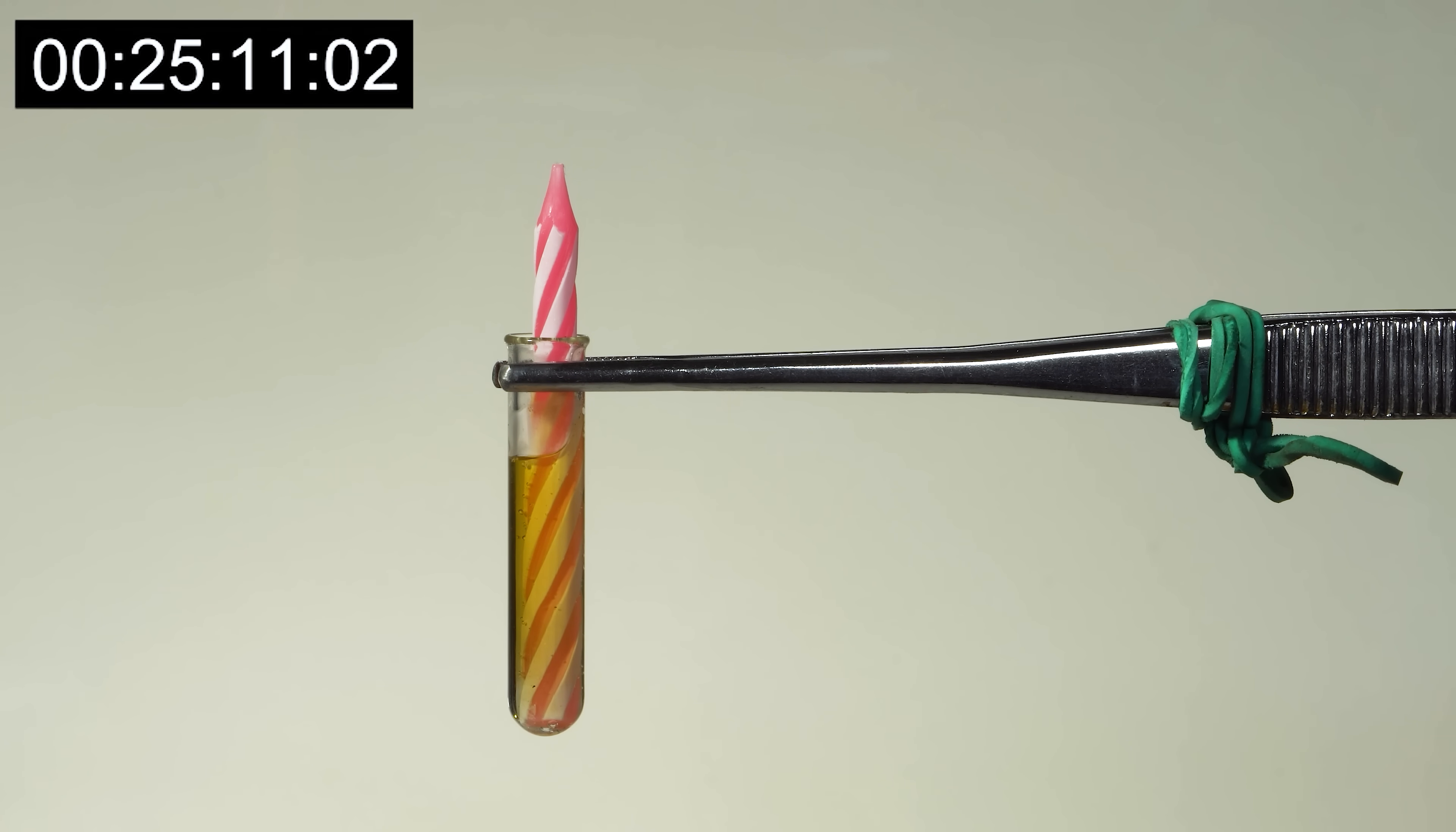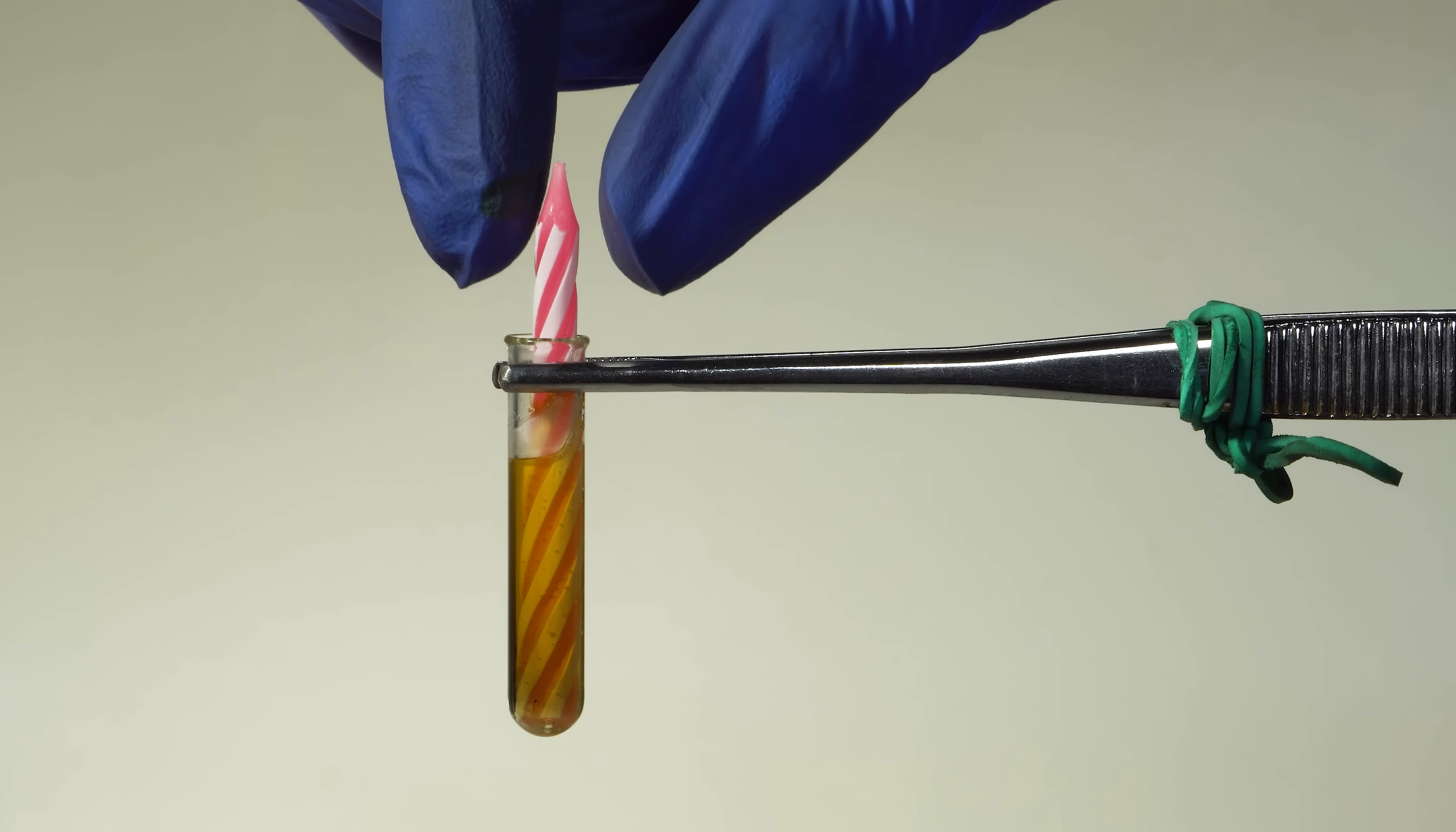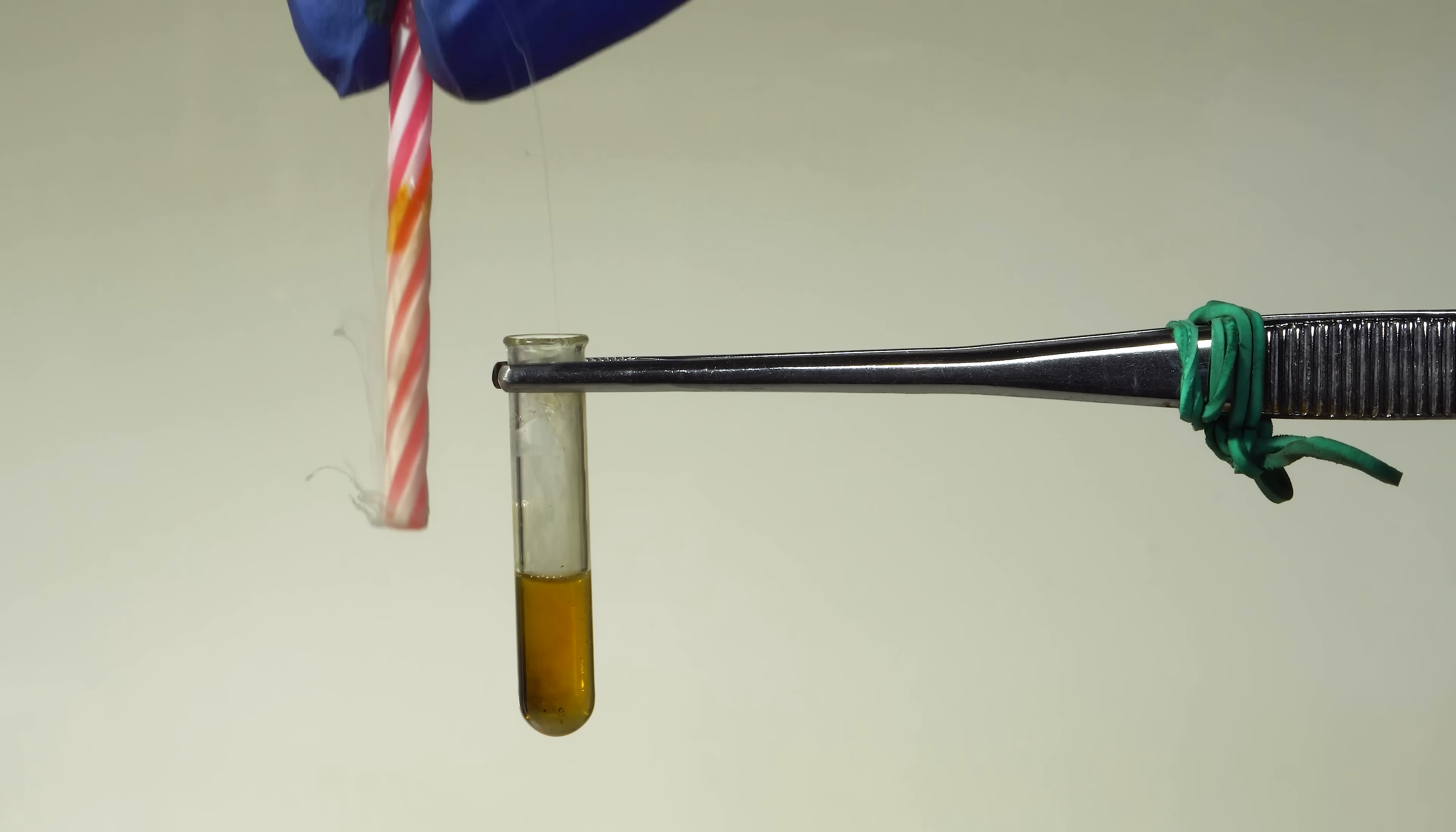In half an hour I haven't noticed any signs of the candle really dissolving in magic acid. The acid just got a little darker. Maybe that's the result of candle coloring reacting with it.